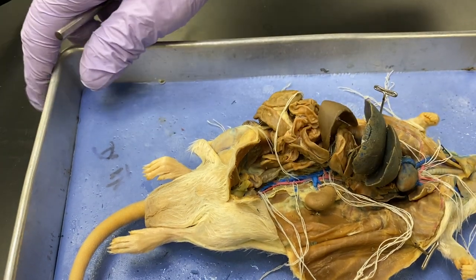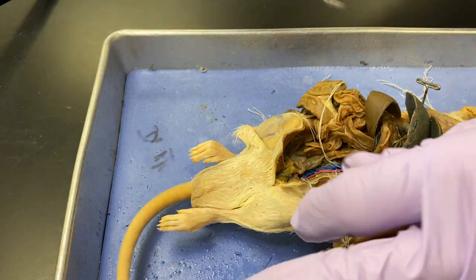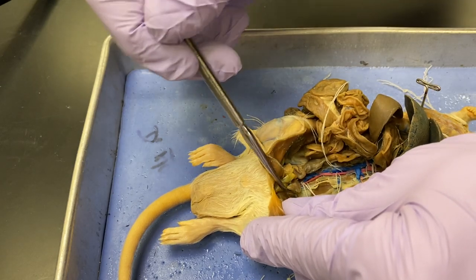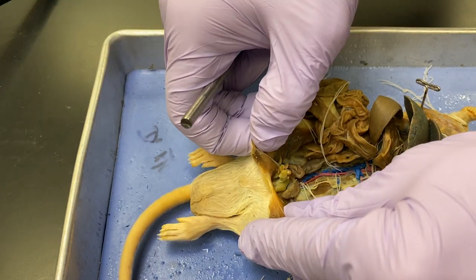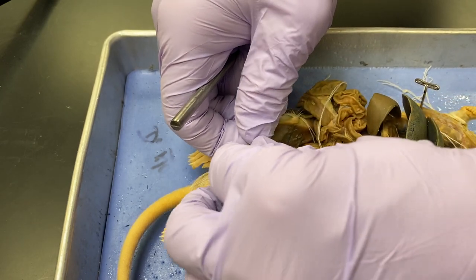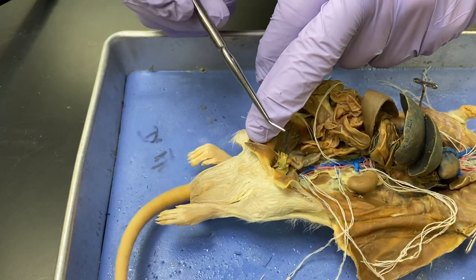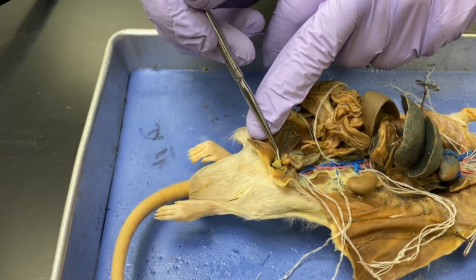This is a male rat. So on this rat you have these big flappy things — we'll deal with those in the reproductive system. Those are seminal vesicles. But when I peel back this abdominal body wall, you see a little peanut-shaped thing right in there.